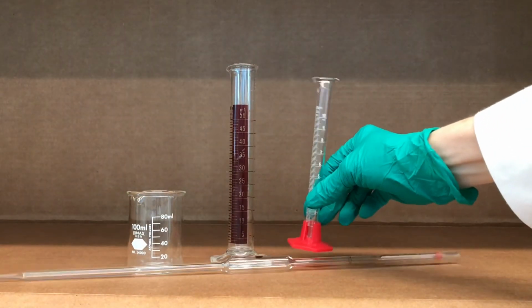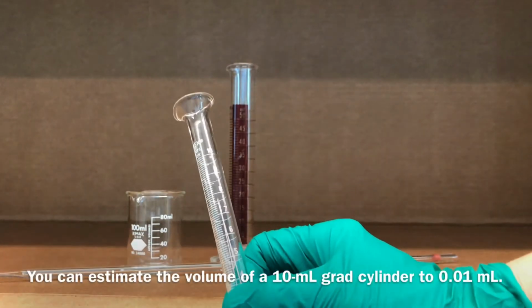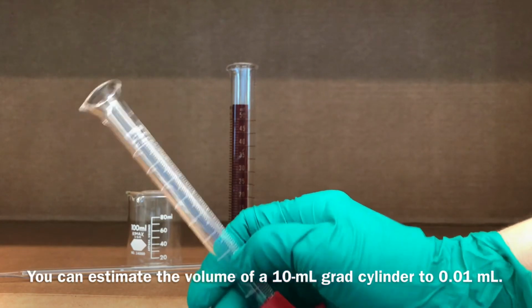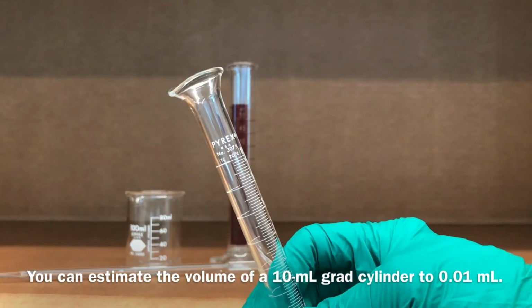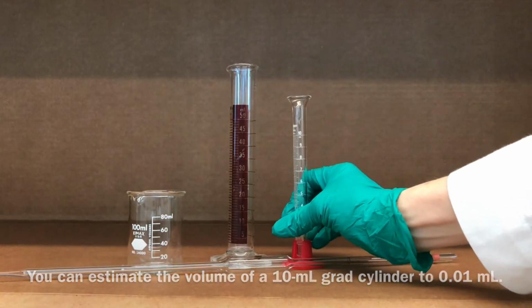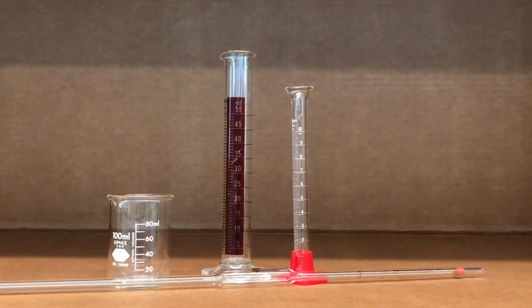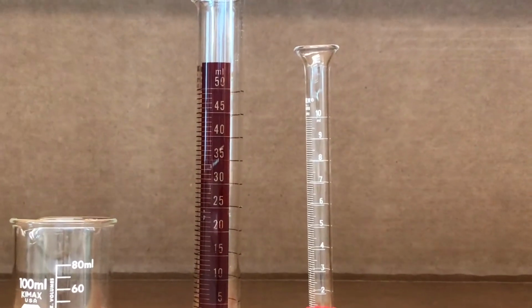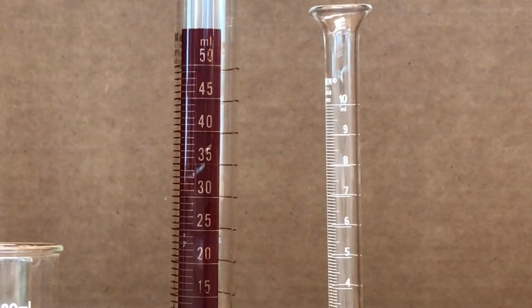I've picked also a 10 mil graduated cylinder here, and it doesn't show us exactly the tolerance that it has, but as you can see, when we compare it to the 50 mil grad cylinder, it has more graduations per milliliter than the 50 mil grad cylinder.